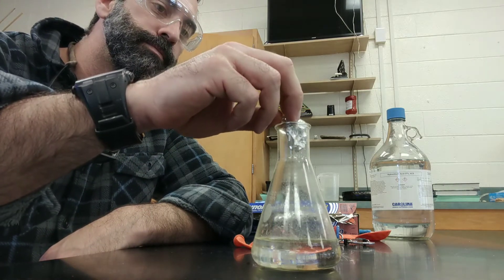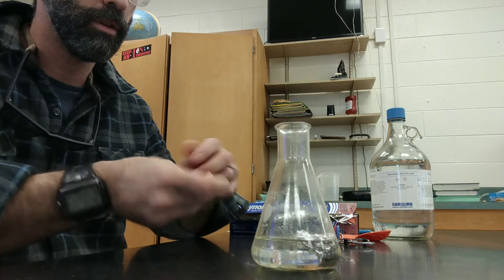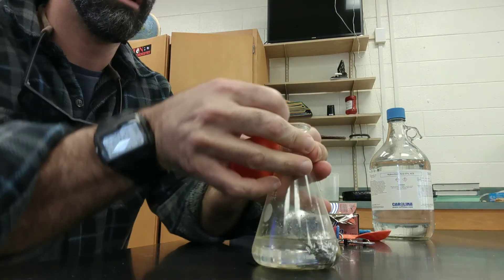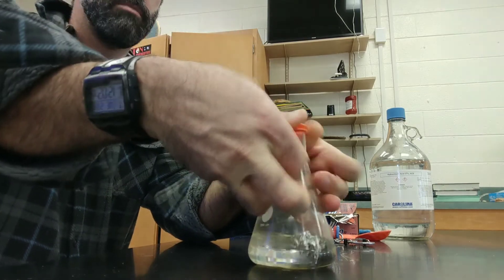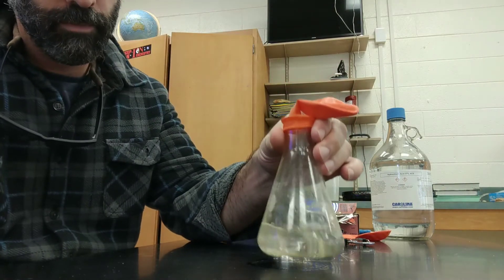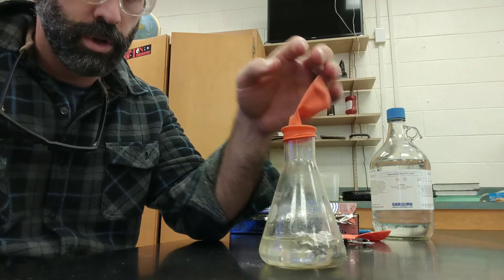Alright, here it goes. Once it's in there, you don't want to wait too long. Just stretch the balloon up over the top. That should be good to go. Give it a little swirl.